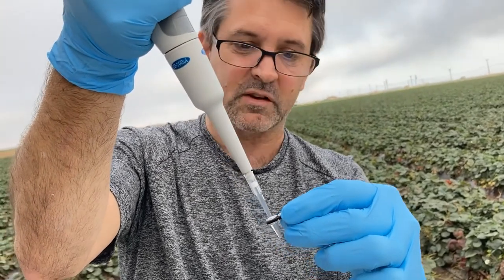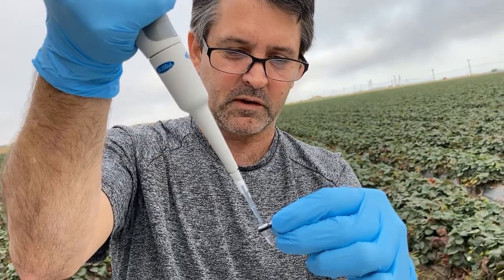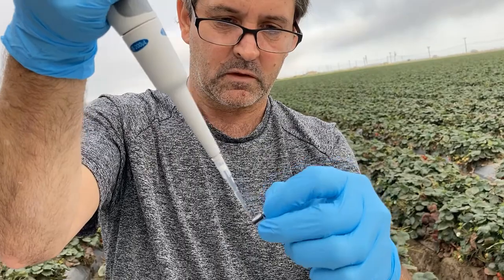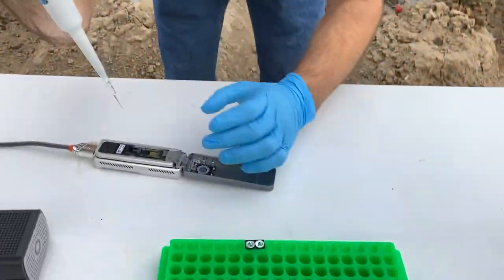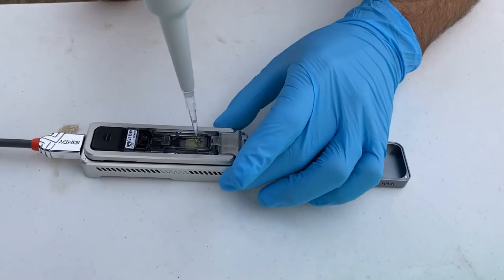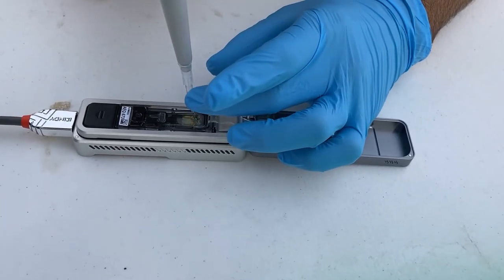Let me get rid of all that. Okay, same idea. We don't want to put a bubble in there. We want to try and find that little pore and then pipette slowly.